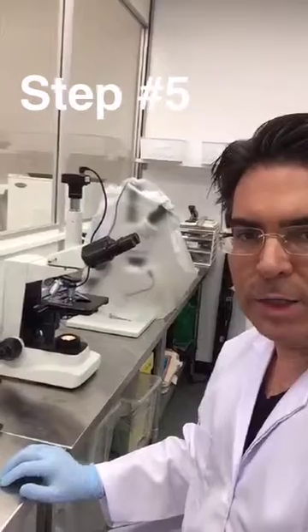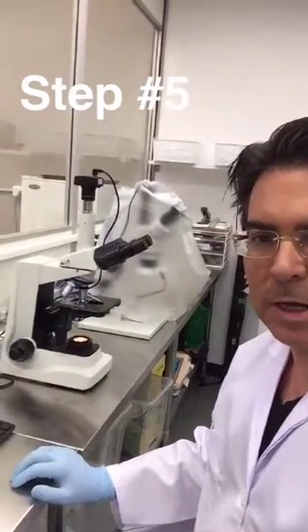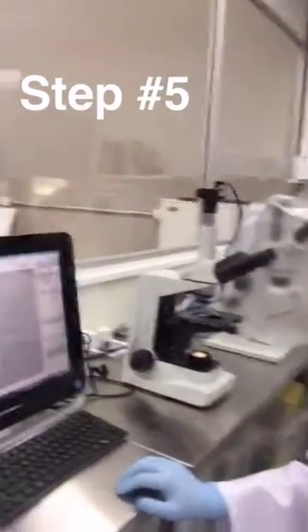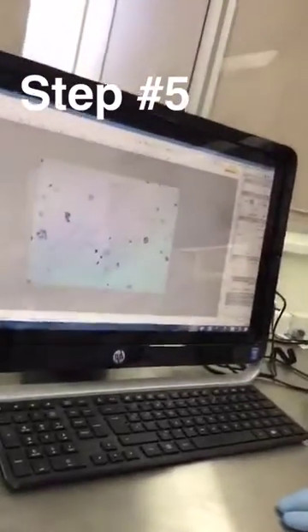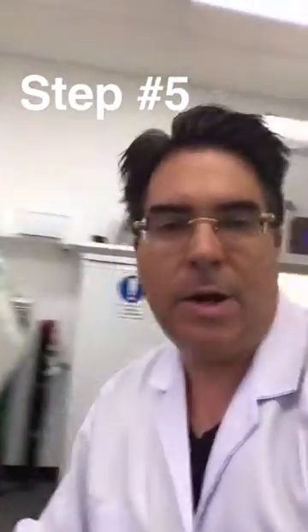Now it's a straightforward process for me to use that microscope slide that's been stained, put it onto the microscope, and then use computerised image analysis to help me identify what's going on.